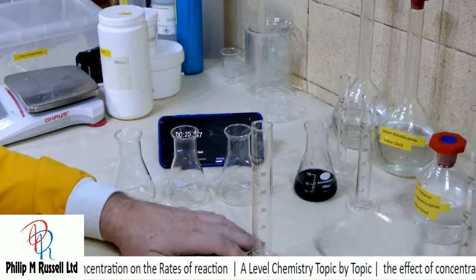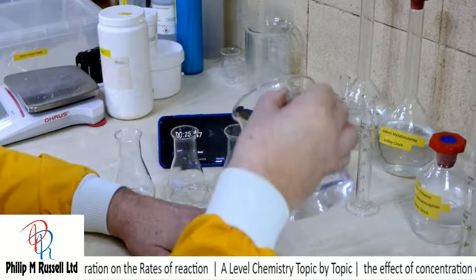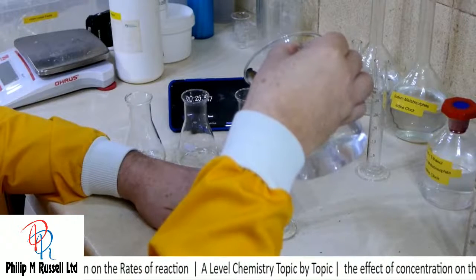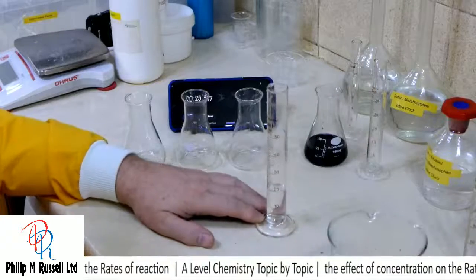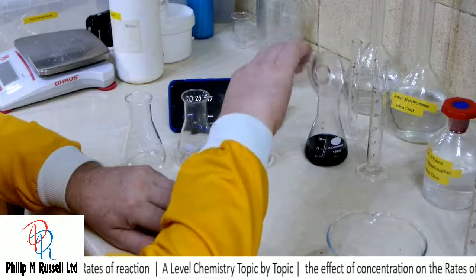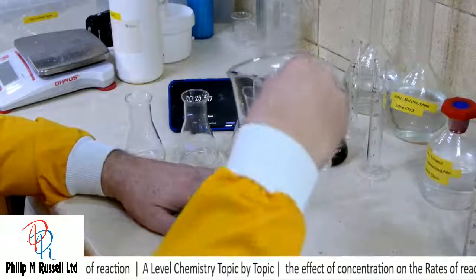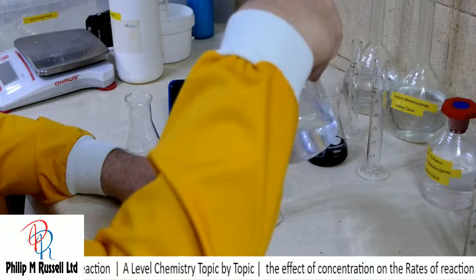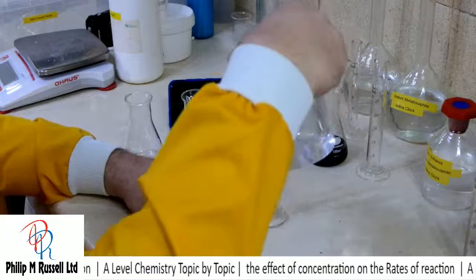So I did one last time with 25, so let's do here one with 20. Let's do one with 25 coming up.